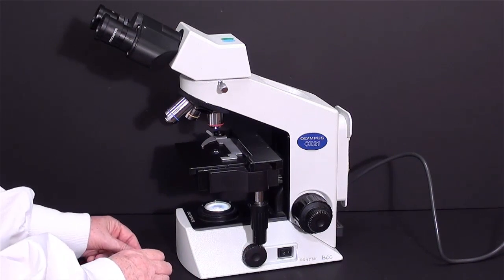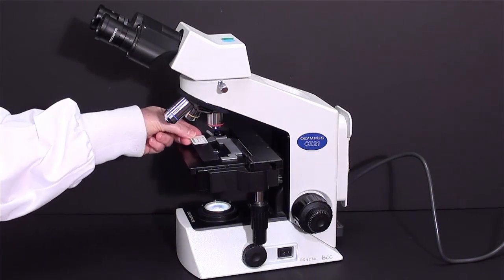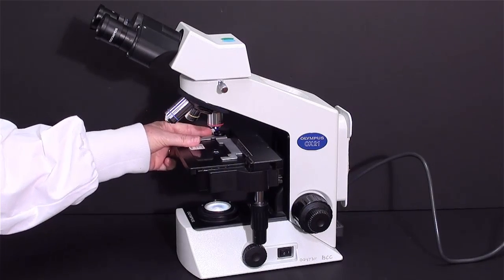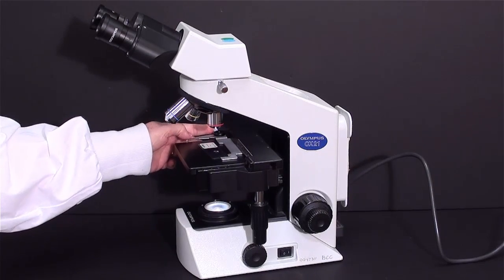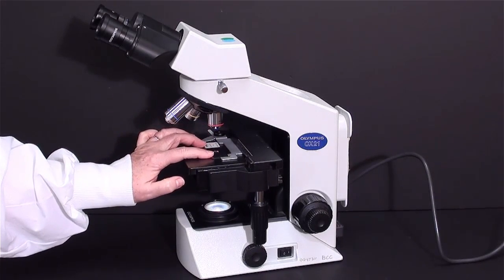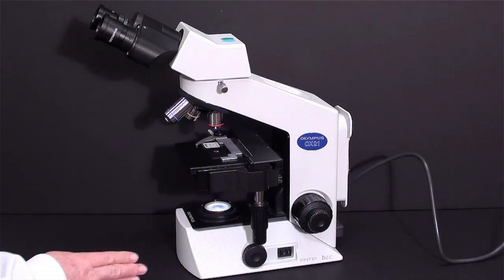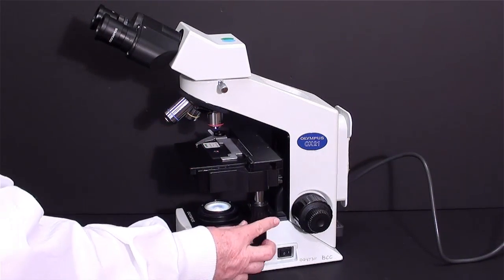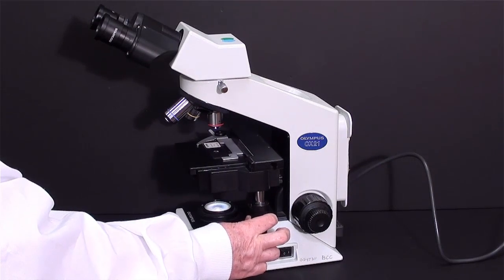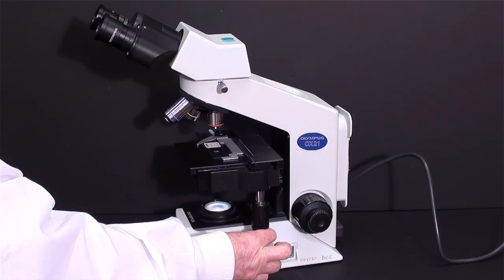I'm going to place the slide on the microscope. Pull back this small lever. Slide the microscope slide into position. Use the stage controls to position the specimen over the light source.